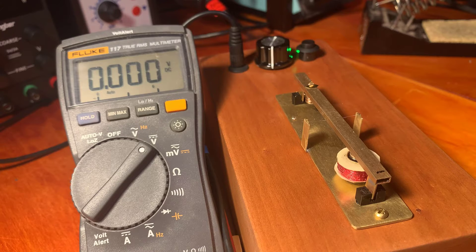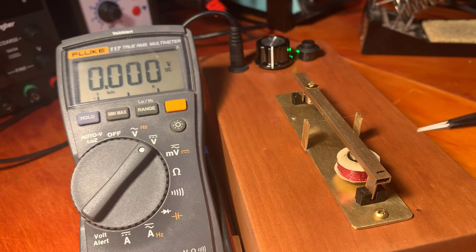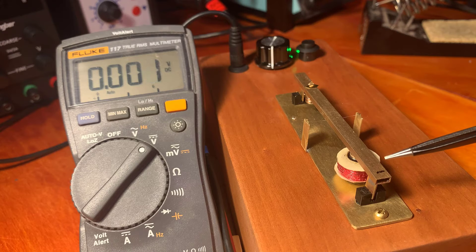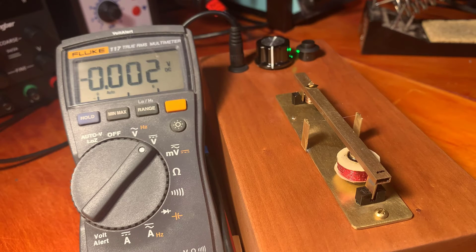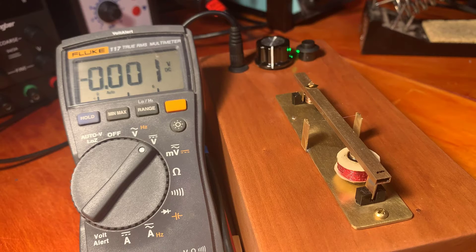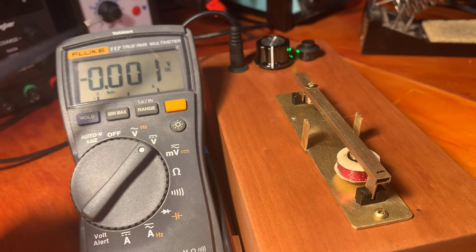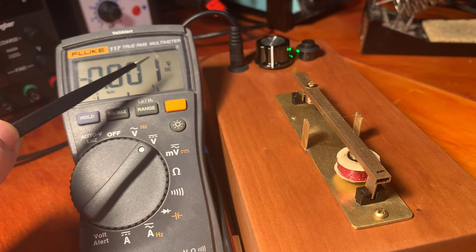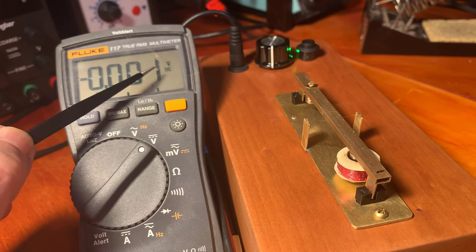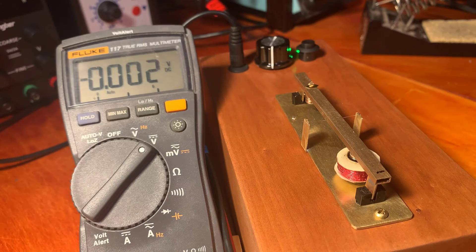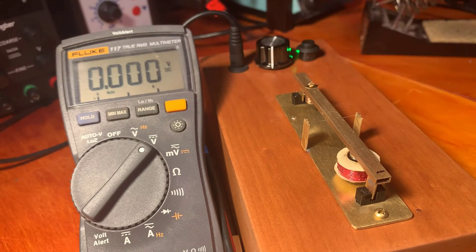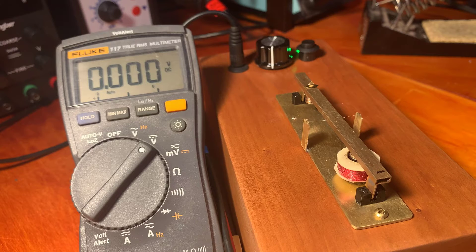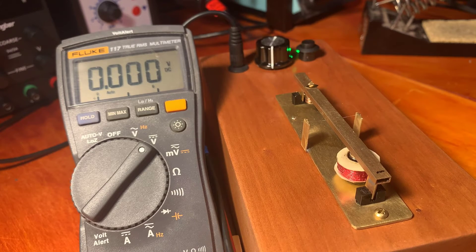Now, if I place something on this black line shown here, then it'll weigh that. And it has a resolution. This last digit, which is millivolts, that last digit is 20 micrograms. So whatever reading I get here, I multiply it by 20 micrograms, and that's the weight.